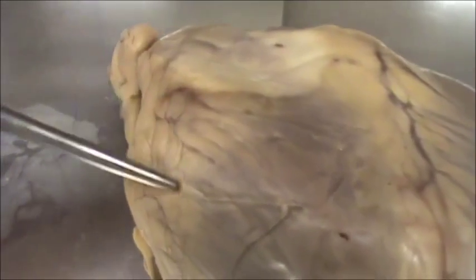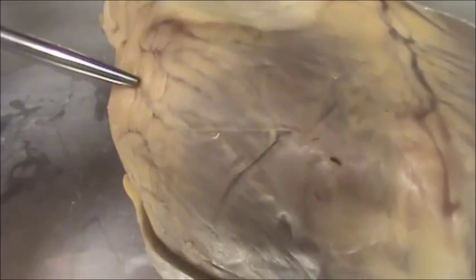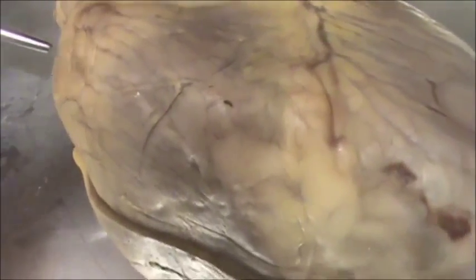The groove separating the atrium and ventricle is called the coronary sulcus. The groove separating the left and right ventricles is called the anterior interventricular sulcus. On the posterior side you can also see the posterior interventricular sulcus, and you can see fat deposition in that region.